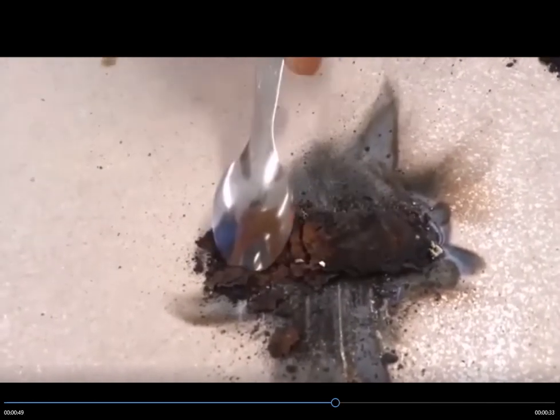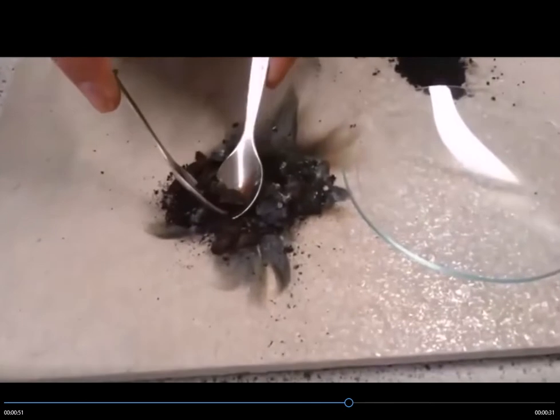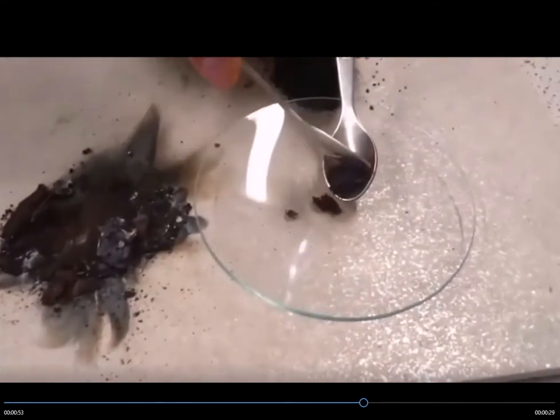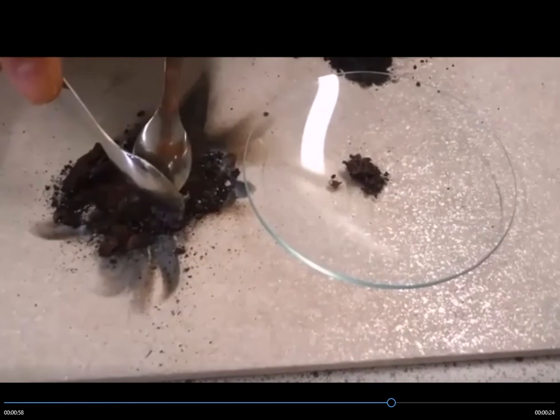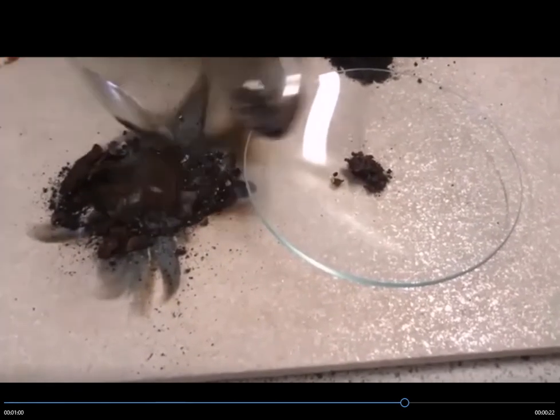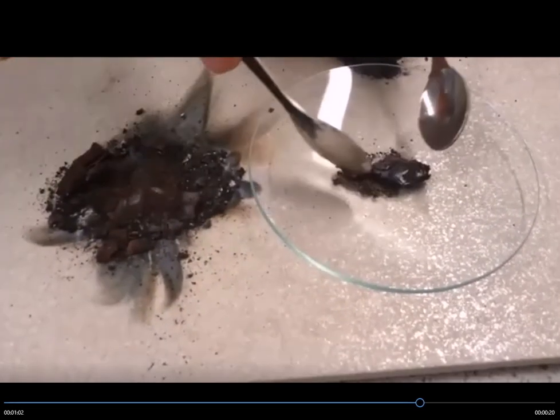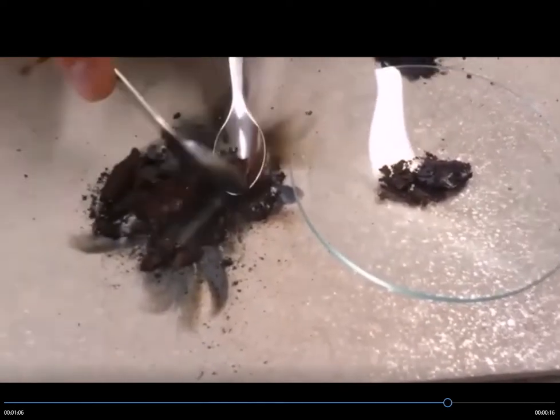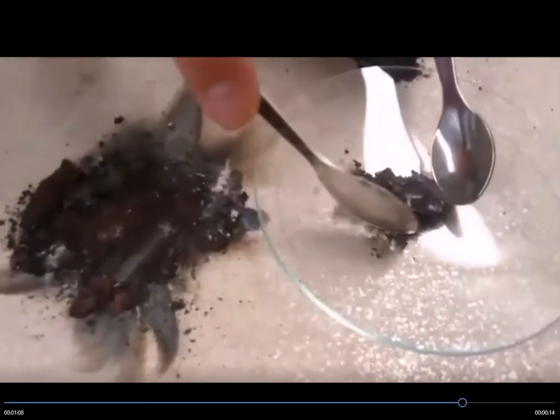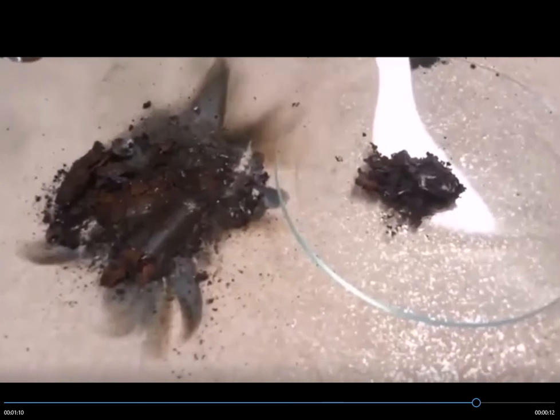Now there's a little bit of it, you can see I'm sort of breaking the mixture up there, and you see a little bit of brown there. But quite often to demonstrate and prove that there's copper, what they do is they add a little bit of acid to it, and then that takes away things that react with the acid. Copper doesn't react with the acid, and you get to see it a little bit better. So they're going to show there that you can demonstrate that there's some copper in that mixture.